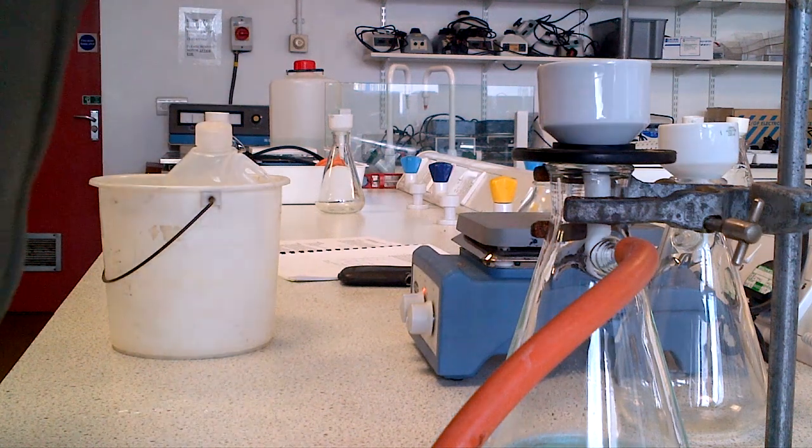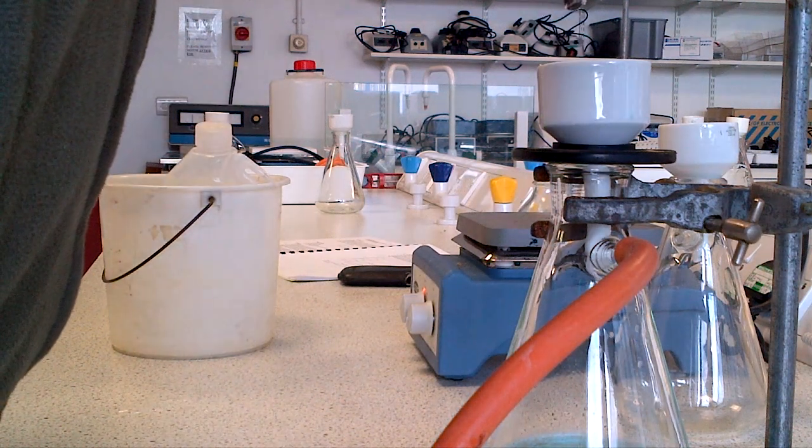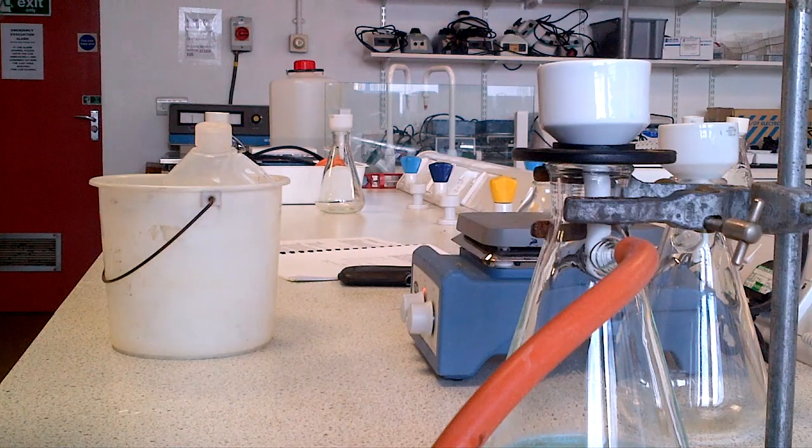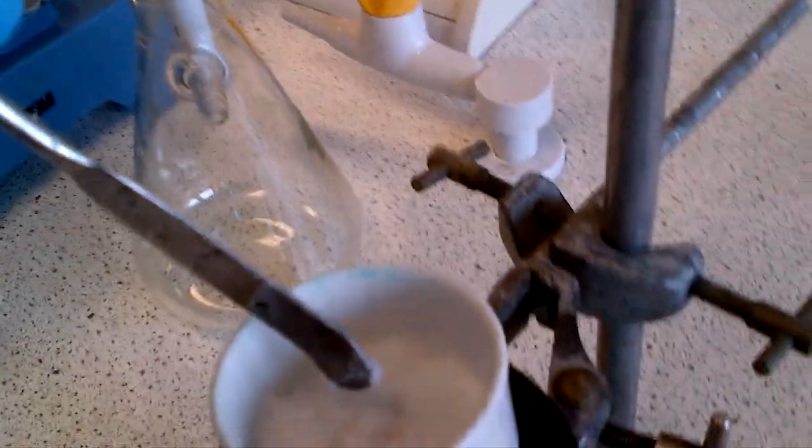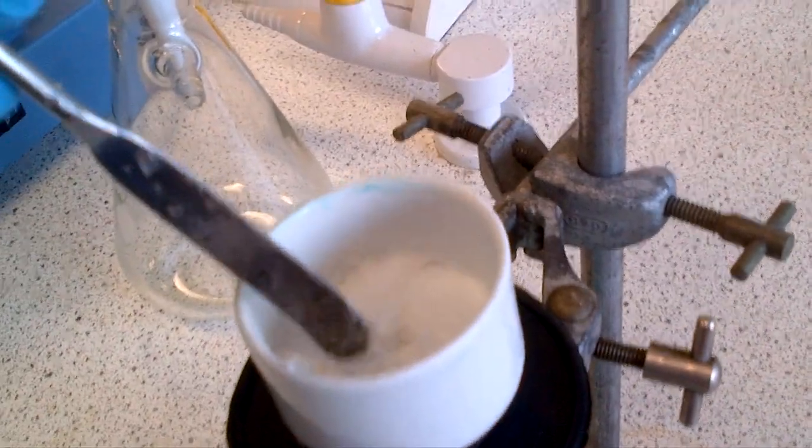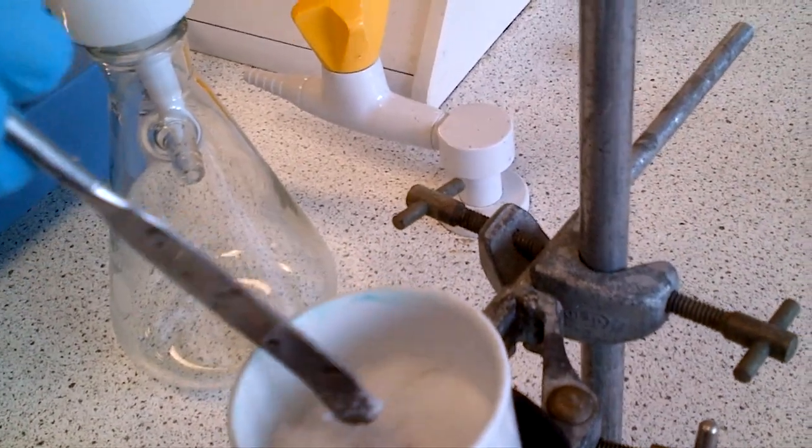Now that's the case, we now turn the vacuum on even further and we allow a period of maybe five to ten minutes on top of the Buchner funnel, and we air dry these crystals.